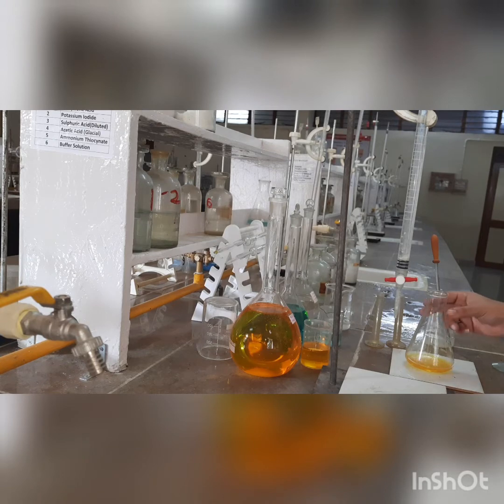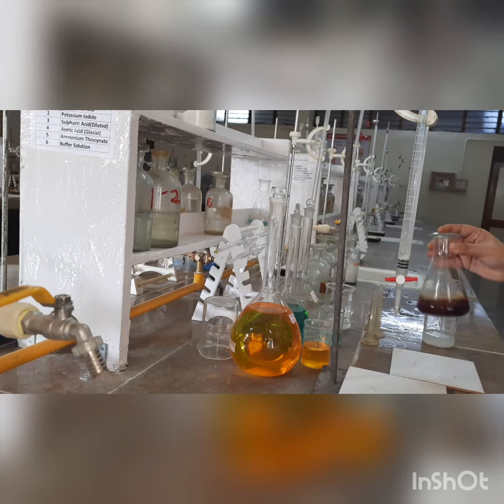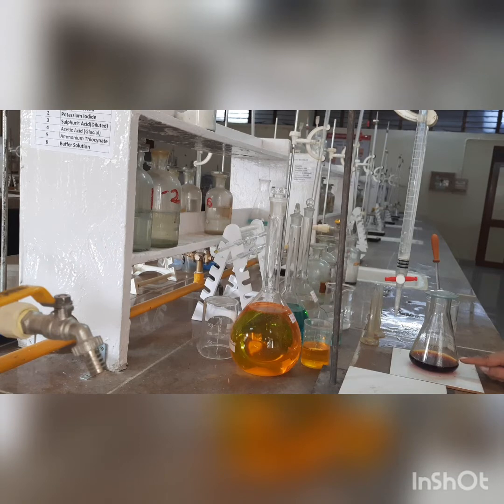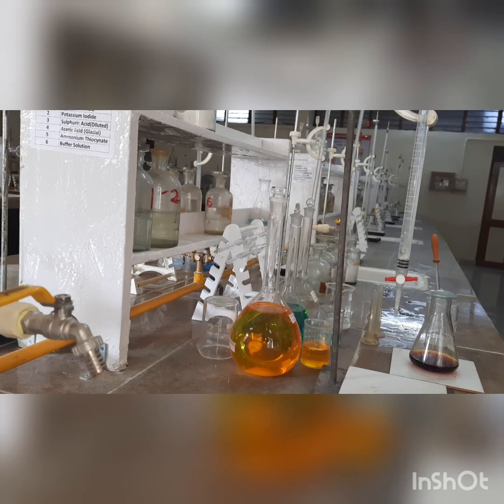Let us start with the performance. This is our K₂Cr₂O₇, that is potassium dichromate; the burette has hypo solution. To this potassium dichromate solution, we are going to add 10 ml of KI and 10 ml of sulfuric acid. After adding these two, we are going to close the mouth of the conical flask, swirl the solution and let it rest for a minute or two. After this, we are going to start the titrations — we are actually allowing the iodine to get liberated here. This should not react with the atmospheric oxygen, therefore we have covered the flask. After doing this, we are going to add hypo solution from the burette in a dropwise manner.